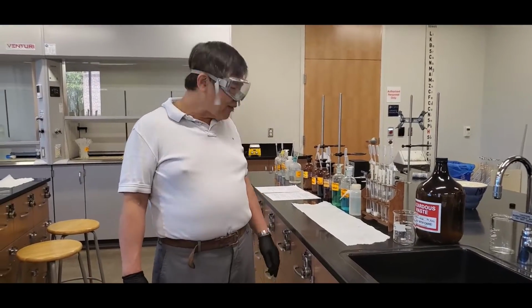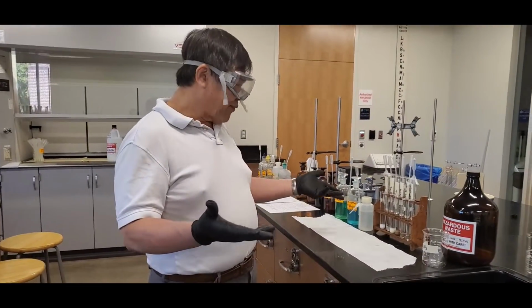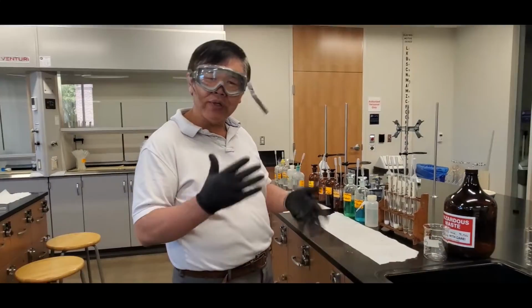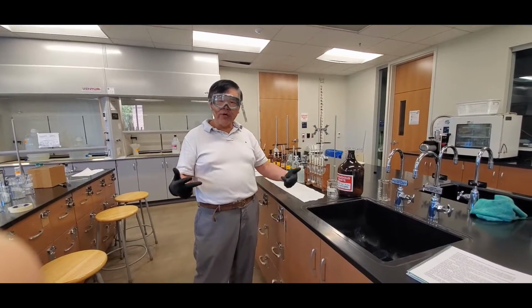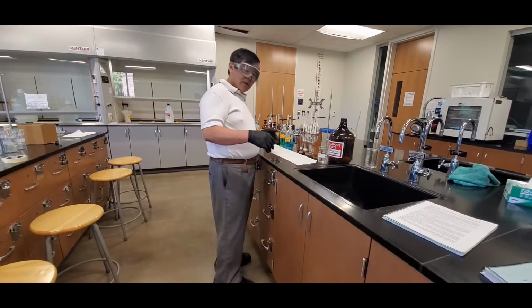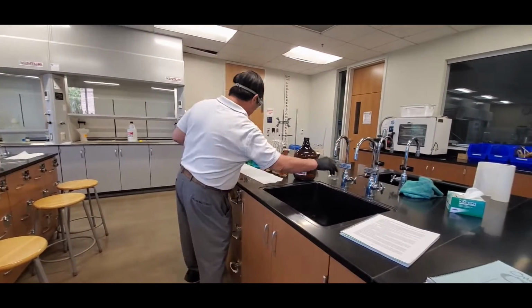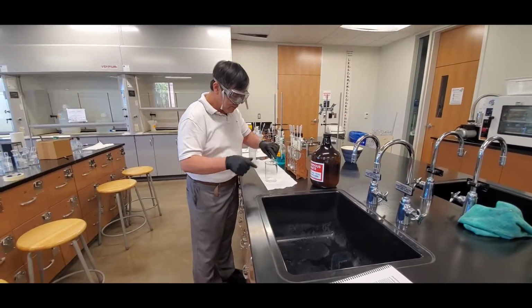All right, class, now that you've done that, let's dispose of the waste into the beaker, and I'm going to show you how to quickly wash one of the test tubes. Afterward, I'll quickly show you the rest of the tests, okay? Here we go. The waste container's right here. Now let's pour the waste in.